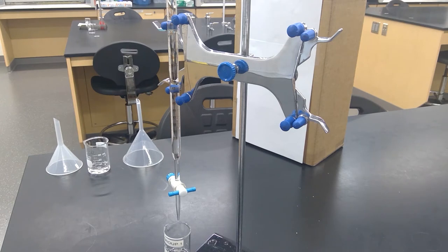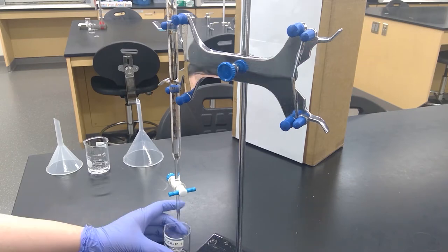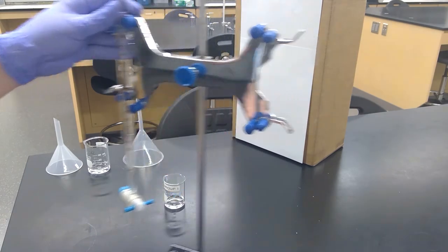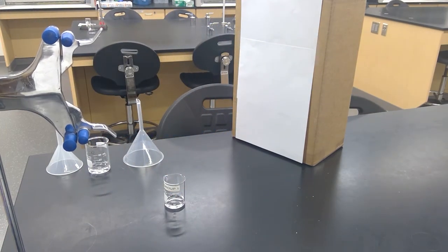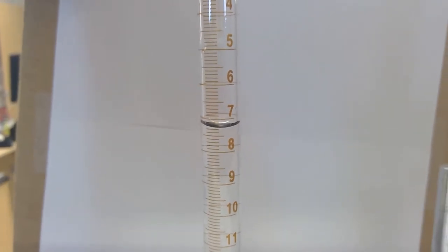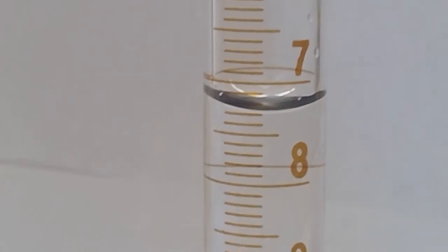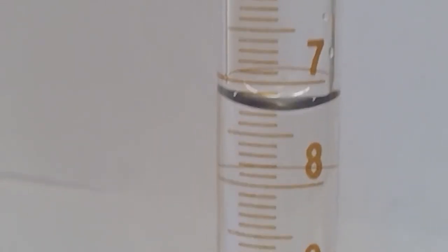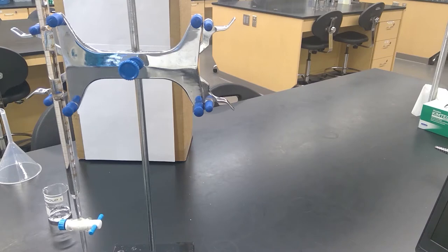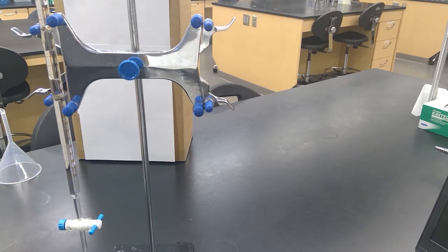Record the new volume on your burette. Now we're at step four: weigh the beaker and water on an electronic balance and record the total weight of the water and the beaker. We'll go to the instrument room.